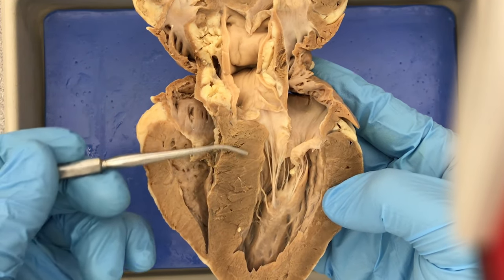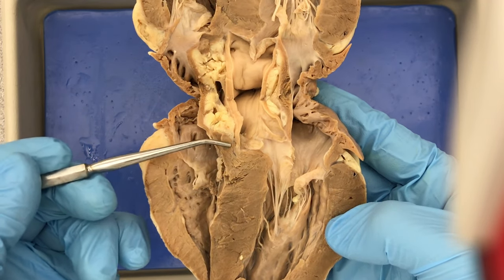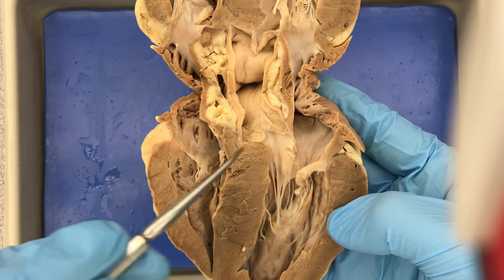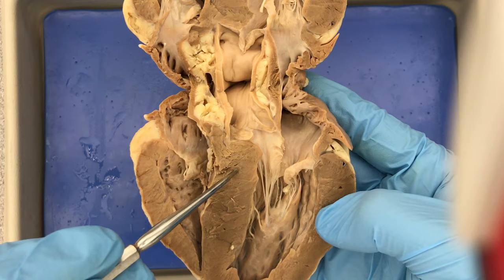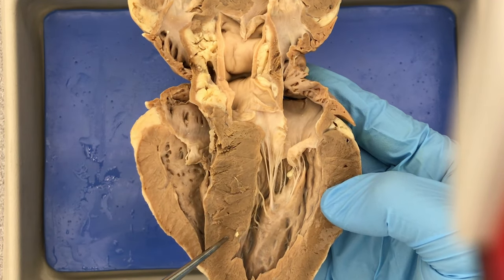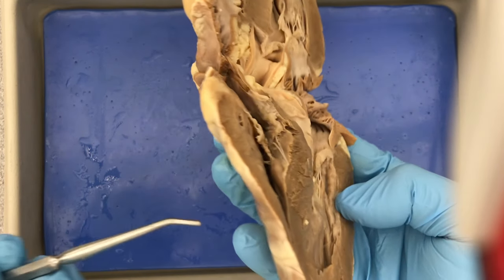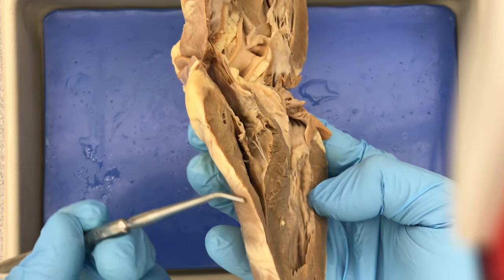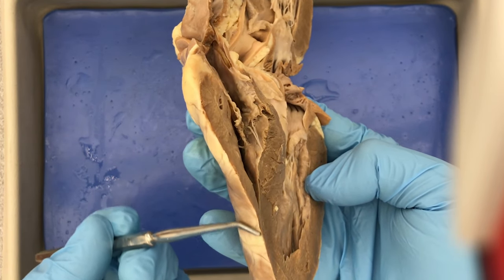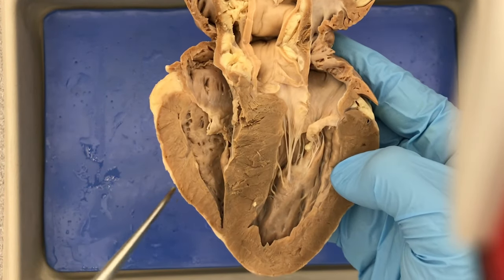You also have this septum here — this is the interventricular septum, separating the two ventricles. From here to here is the interventricular septum, and from here to here is the interatrial septum.